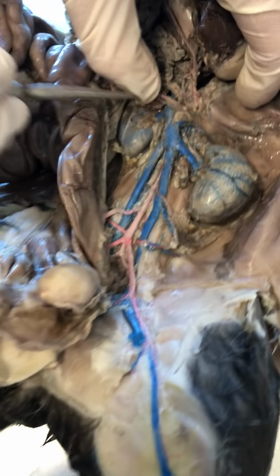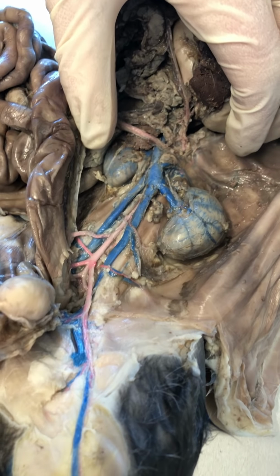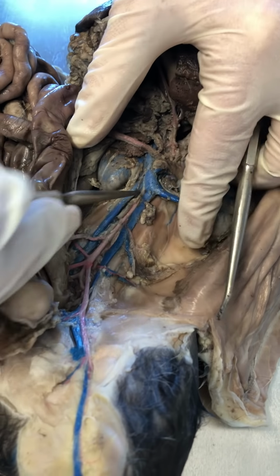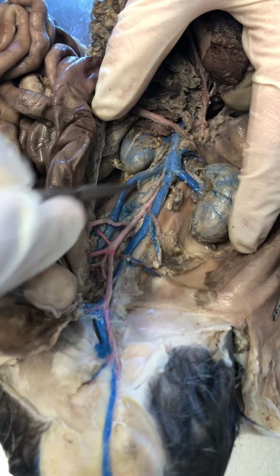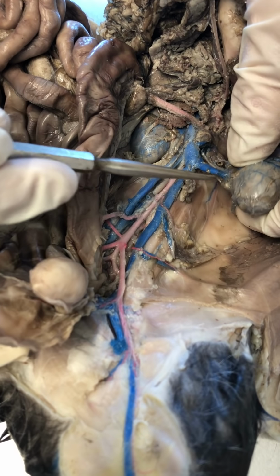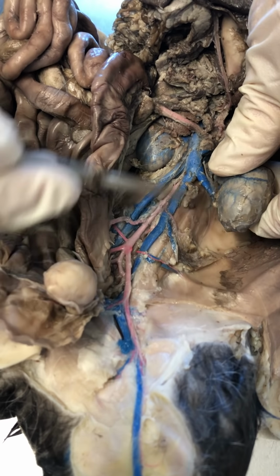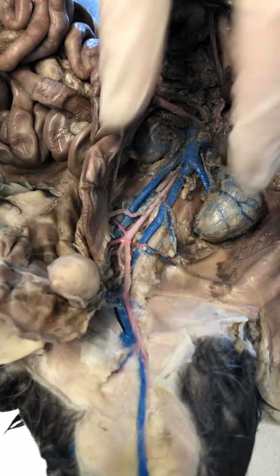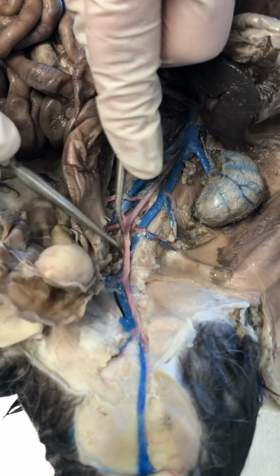Okay, so here's my kidney, here's a kidney. The vein going to each kidney is my renal. Okay. Now on this cat, its anatomy is a little weird. So this is going to be my gonadal vein coming off of the right side. On the left side, there will be another gonadal vein that got broken off, but it branches directly off of my renal going to the gonads. Okay. So then below the renal, we ignore everything until we get to the iliacs.